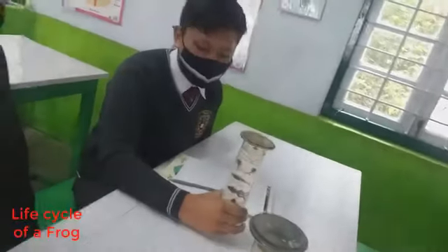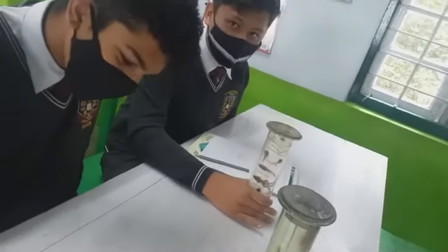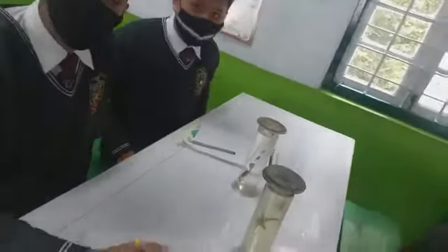Okay, what is that? Frog. So it's showing a complete life cycle of the frog, it seems. Is it? Yes. Okay. Draw them all nicely and get the details. Here we have got the specimens of snakes also. Different types of snakes we have got here. So afterwards, once you finish it here, you can just have a look at it.